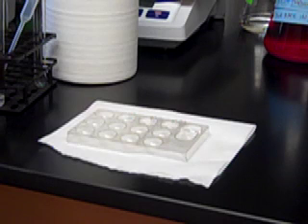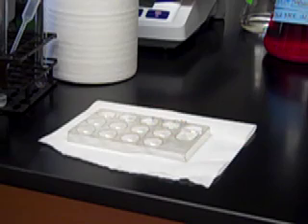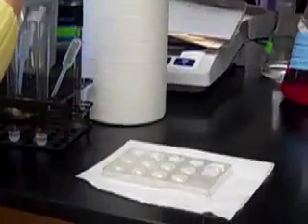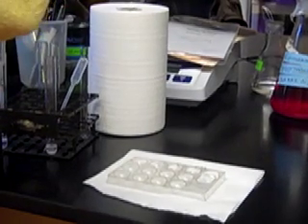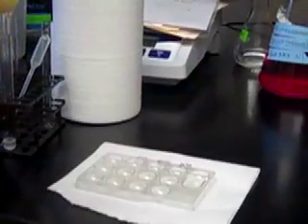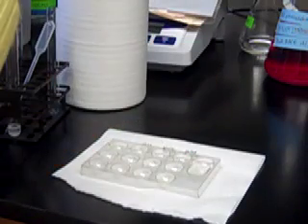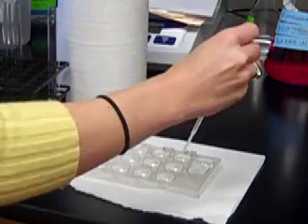While we're waiting for the Benedict's test, we're also going to conduct an iodine test. Iodine is specifically for starch. We're going to use the spot plate and I'm just going to put two or three drops of each sample in the different spots. So this one is water and saliva. This one is water and starch — I need to make sure I've swirled it sufficiently to get a good sample. Then we have saliva and starch as our last test.